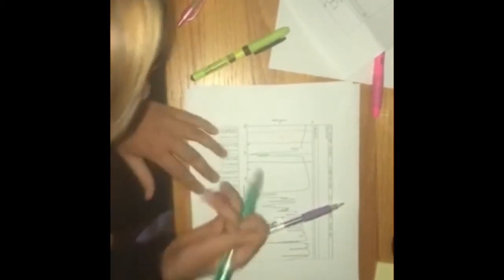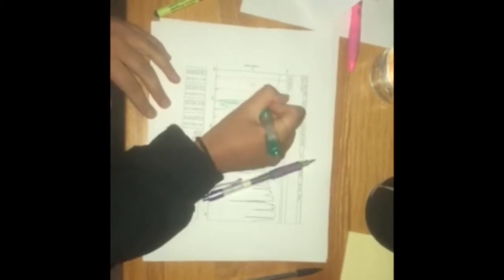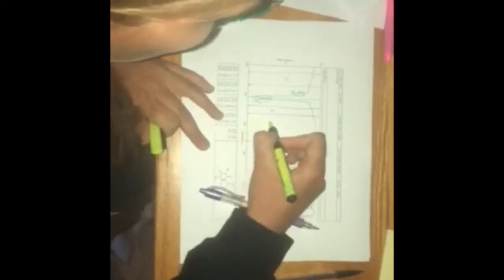In just zone 2, we have an indication of an sp3 right here because it goes past the 3000 mark. So that means we're going to have some sp3 and also sp2 because of this maybe right here. So some double bonds in there as well. And so then we move to zone 3 and we have nothing there. And then zone 4 right here, nothing there.